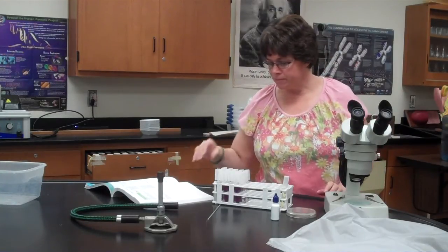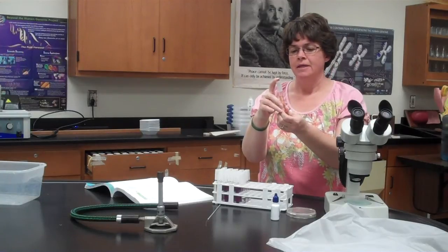So for this lab, each student will be given one tube of mold or yeast. I might have it just mold. Yeah, I think I'm going to do it that way. I think we're just going to only do molds. And so each student gets their own tube. They will not be labeled with the name of the mold. They will be just numbered, okay? So when you take your tube, basically you're going to write your number on your plate rather than the name. So one tube, one plate per student, okay? It's going to be up to the student to properly identify the mold.